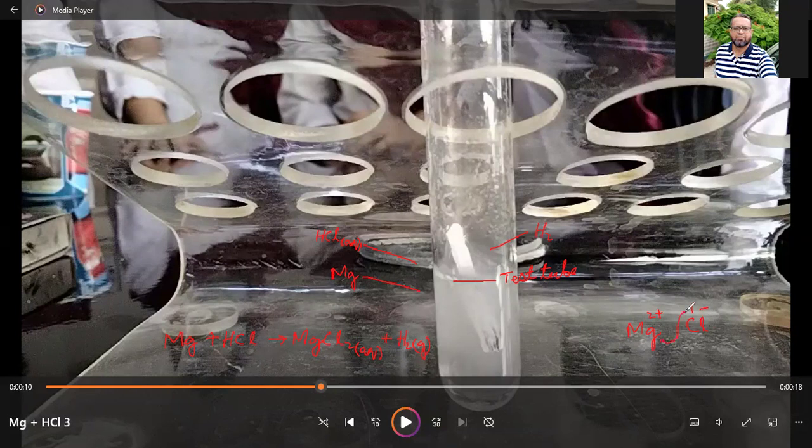Or as per the rule, the charge on one of the ions is made the subscript of the other element for writing the ionic formula of the ionic compound. So the formula becomes MgCl2. So for balancing, we can put 2HCl here. So actually this reaction is going on, and hydrogen gas is evolving, which can be collected here.